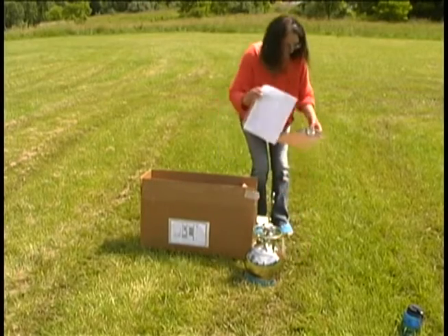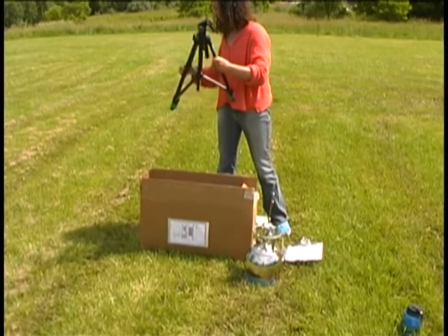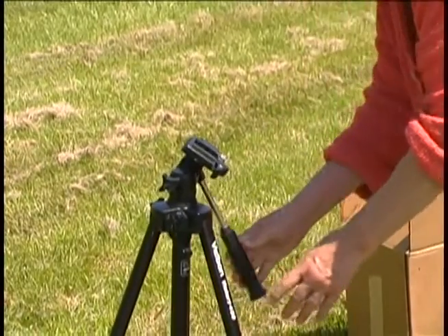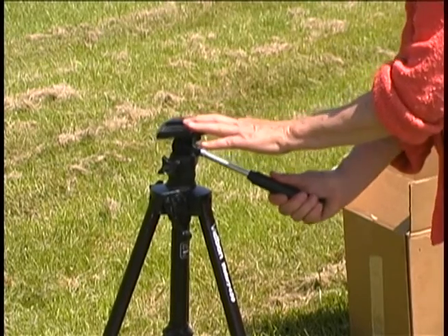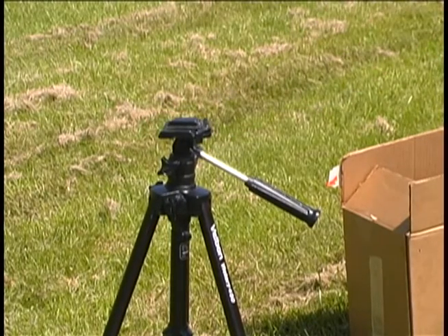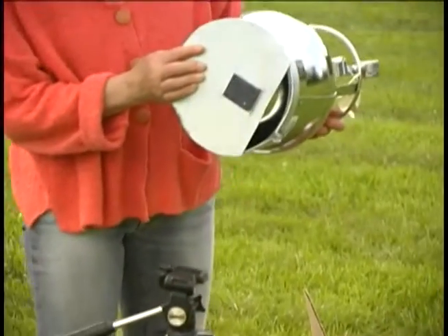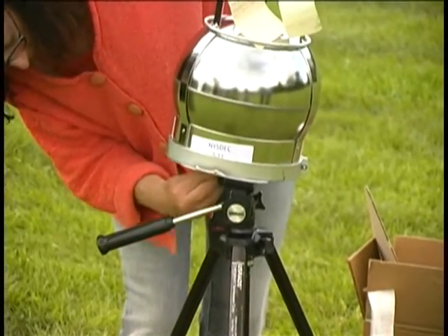Remove the tripod from the box. Set up the tripod and extend and latch the legs. Secure the tripod platform by tightening the platform handle. Double check that the platform is secure. Fit the release plate on the bottom of the canister onto the tripod, matching front to front and back to back. Make certain the canister is secure.